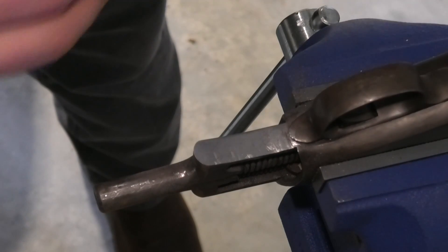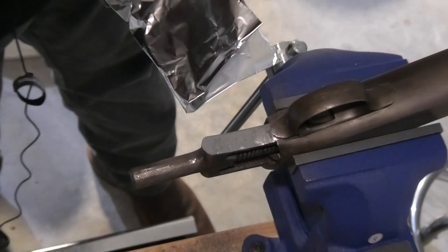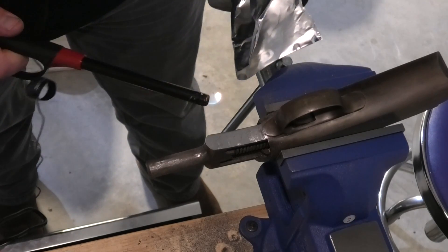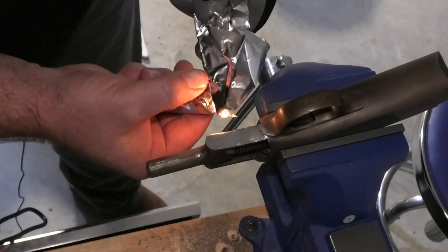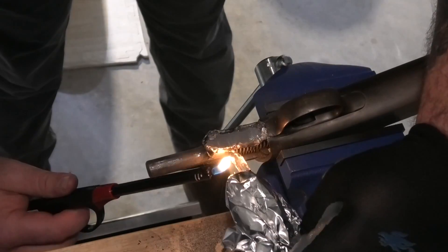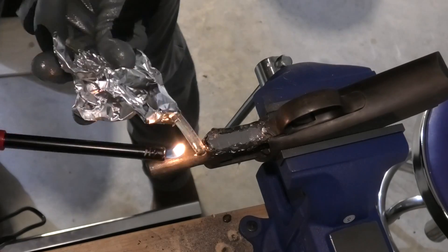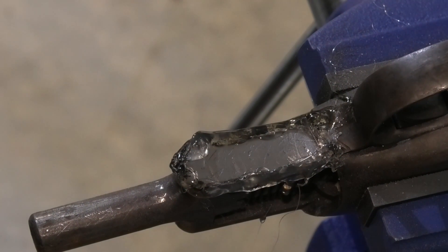Let's try it like this — is this going to work or is this a terrible idea? There's only one way to find out. I probably wouldn't call that perfect laboratory procedure, but I think it worked out all right.